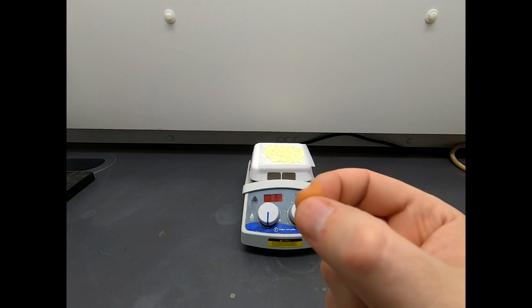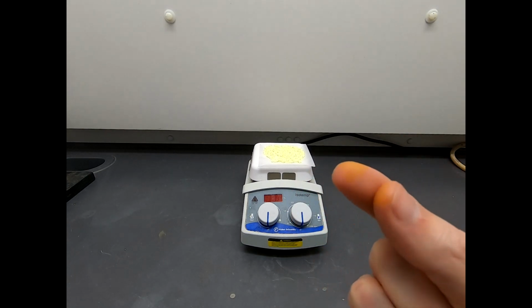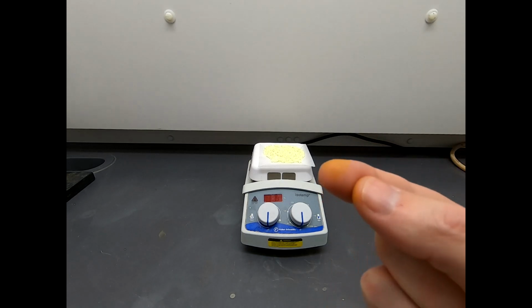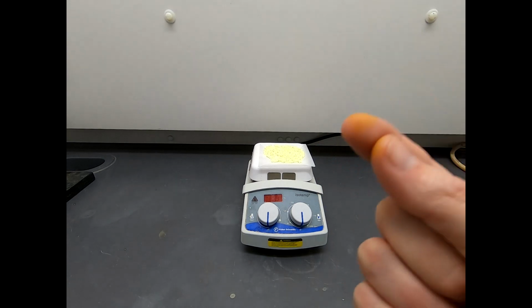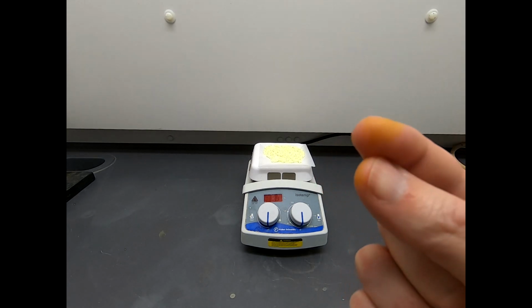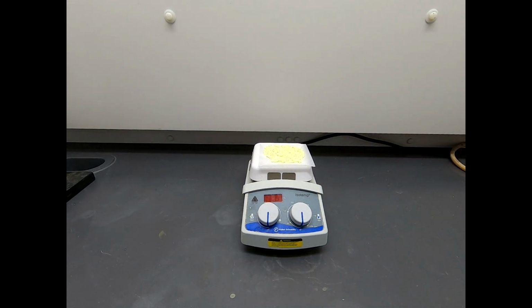So here I'm right-handed, I'm using my index finger and thumb to grab things, and something had a little bit of nitric acid on it, and that discolored my hand. Now, this didn't hurt, it didn't burn, it didn't irritate me, but this is definitely a chemical exposure effect. So just beware. Sometimes you feel like you're not getting stuff on your skin, and it doesn't matter. And sometimes the chemicals will tell you otherwise. That happens sometimes when you work with nitric acid. It will yellow your skin. Okay, so let's take the next step and let's look at the characterization data.